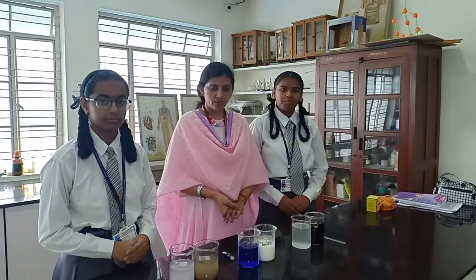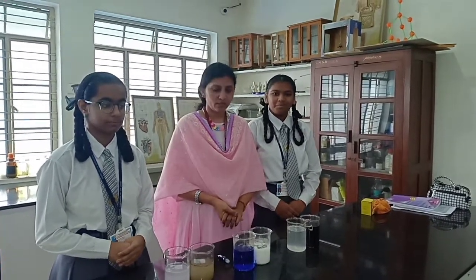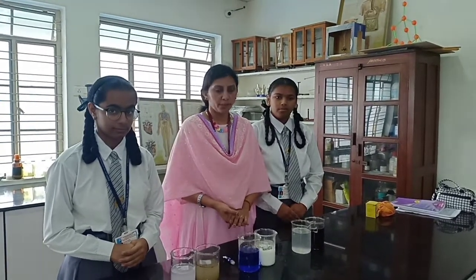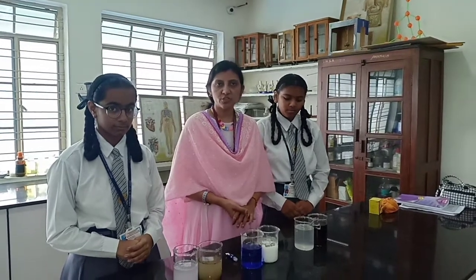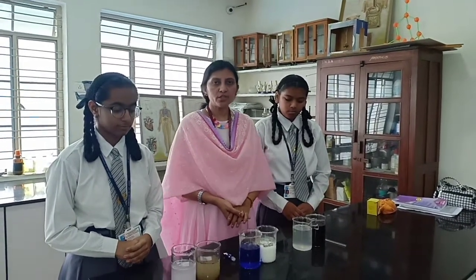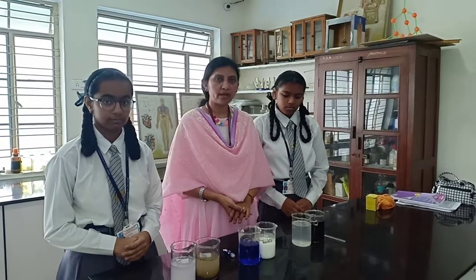Hello everyone. Today we are going to do a science activity related to the Tyndall effect and mixtures. Now there are two types of mixtures: homogeneous mixture and heterogeneous mixture. In the homogeneous and heterogeneous mixture we are having three different types — that is solution, suspension, and colloid.